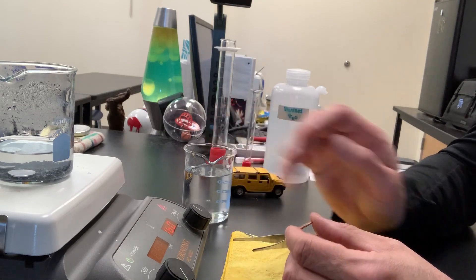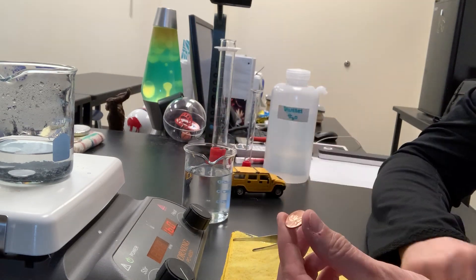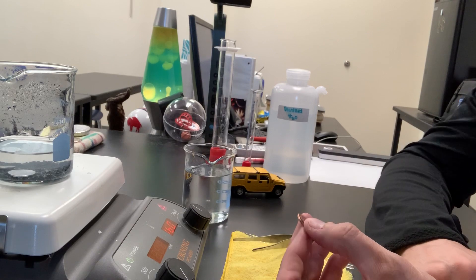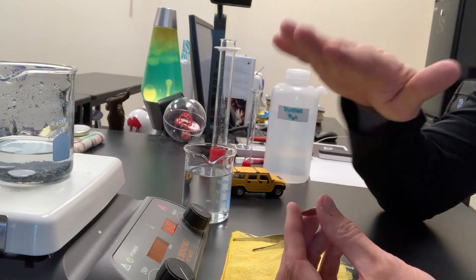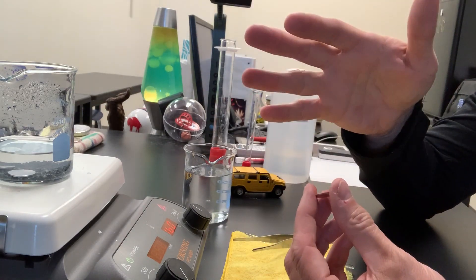What I'd like to do is get the elemental zinc from that beaker to plate onto the surface of this penny. So I'd have a heterogeneous mixture of zinc on top and copper on the bottom. I'd have layers.